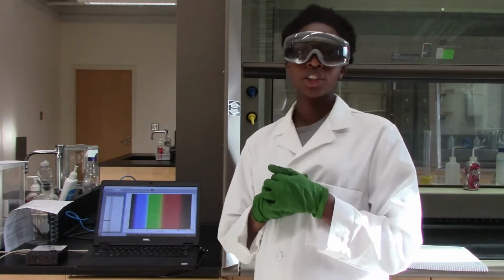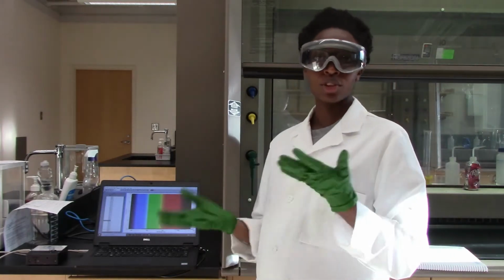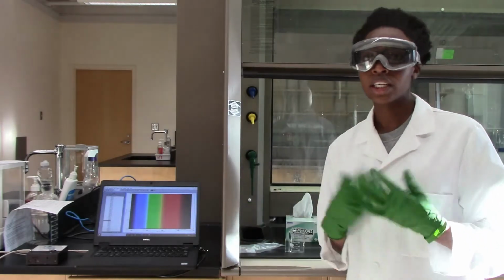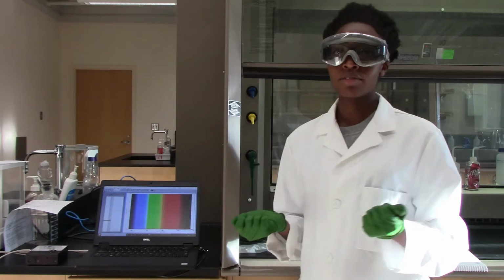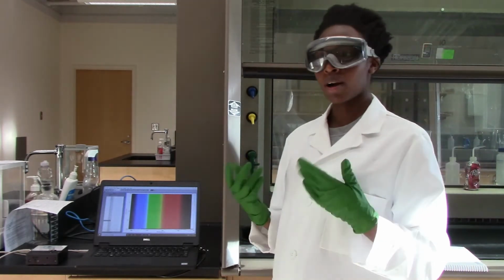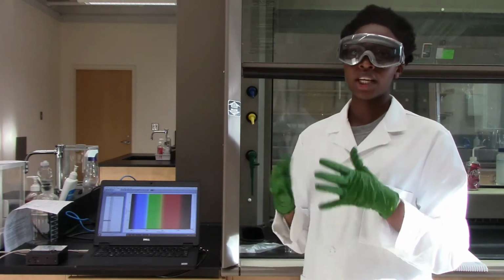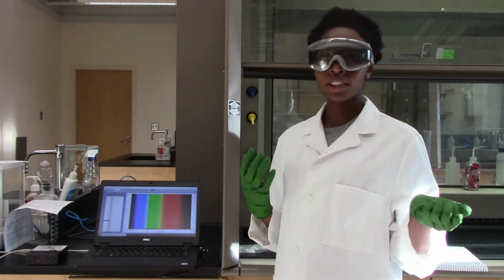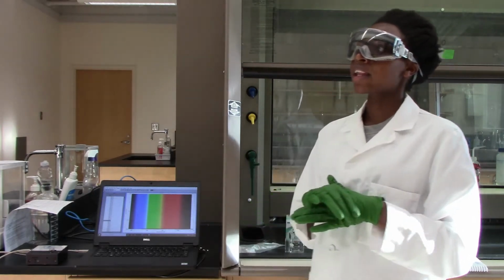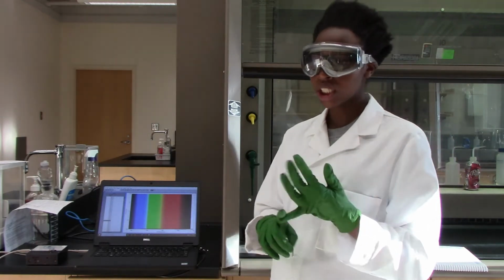So we are going to use chlorine bleach, which is common to you all. I'm very sure that you've used it or you have at least come in touch with it. So chlorine bleach is a common cleaning agent, and its active ingredient is the hypochlorite ion. It has the chloride and the O ions, and so it is an oxidizing agent. That means it readily gives up its oxygen and it is reduced in the process. And so in this experiment we are going to use the chlorine bleach and also dye.